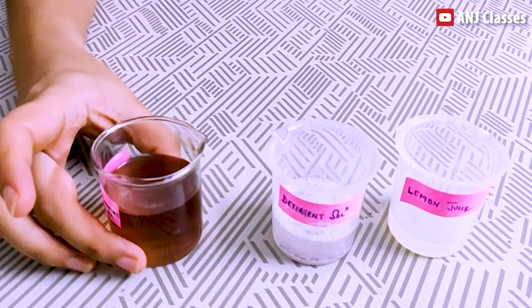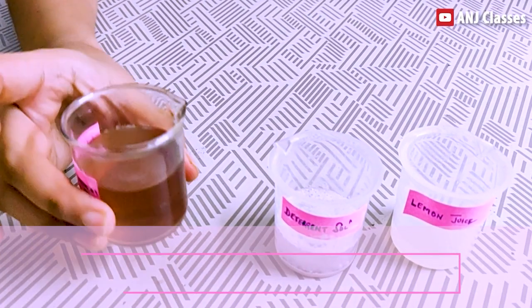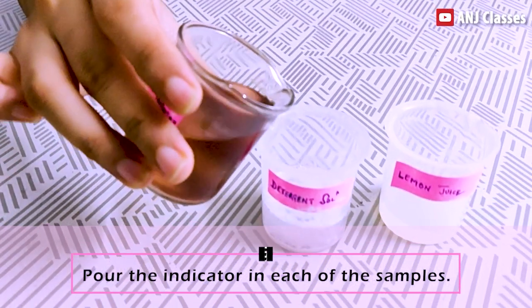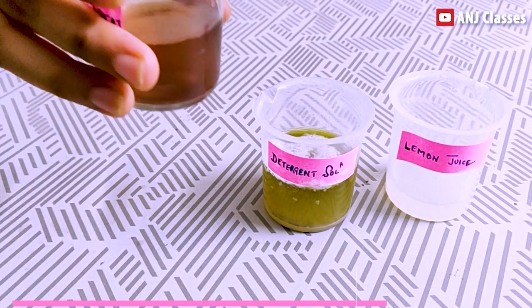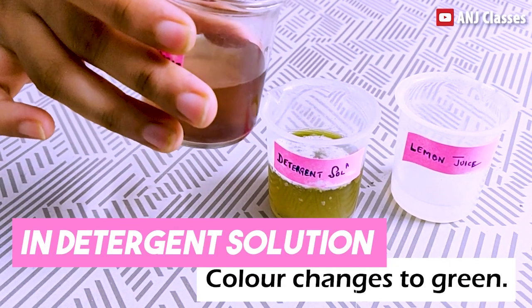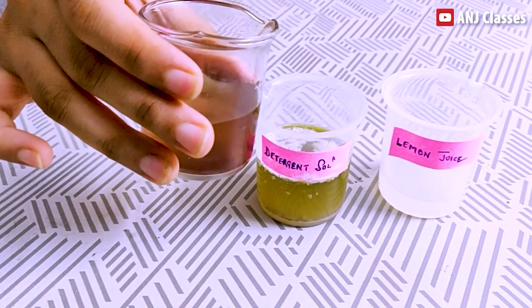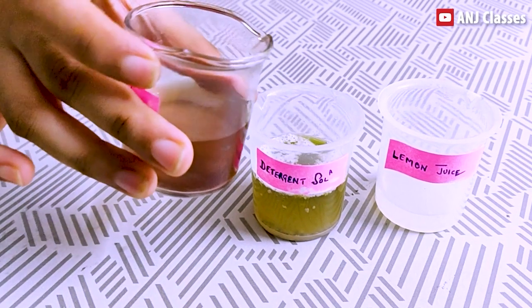Now I will test with this China Rose Indicator. First I will pour it into my basic solution, that is my detergent solution. You can see here the color changes — it changes to green. So it means the detergent solution changes China Rose Indicator to green.